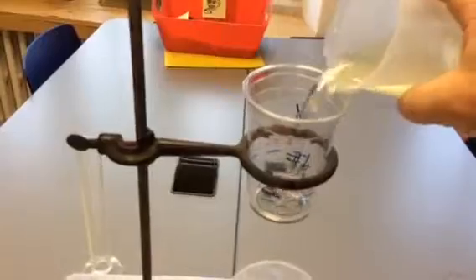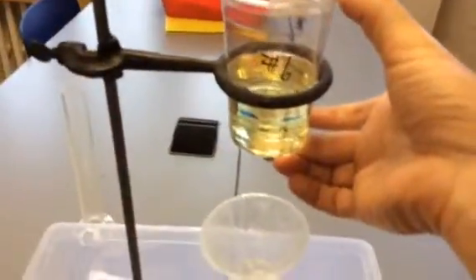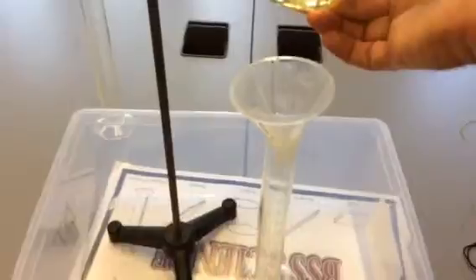Okay, so let's see, what's that going to look like? So for instance, you would pour all that oil in there, except that someone would have their finger over the opening right there. You'd make sure it's lined up with your graduated cylinder. Someone would be ready to measure when the oil gets to 50 milliliters. Someone would be starting the timer. They'd say, ready, go. Finger off the opening.